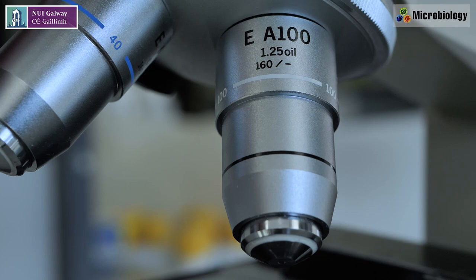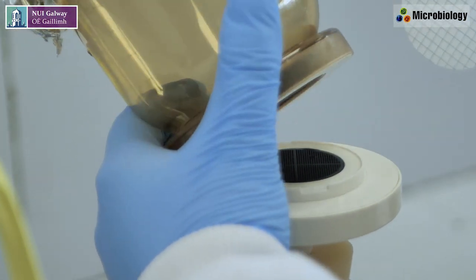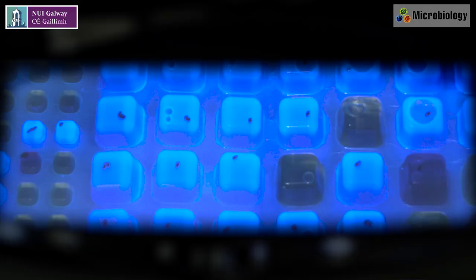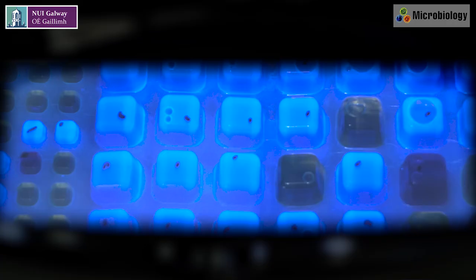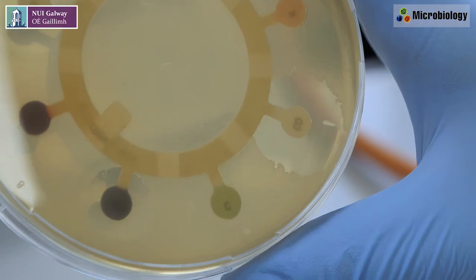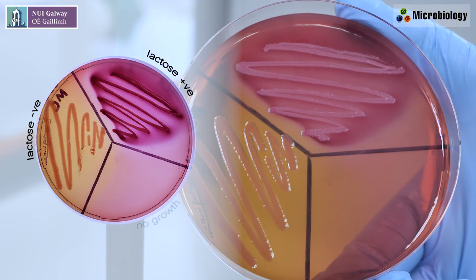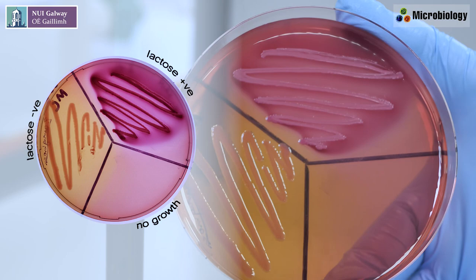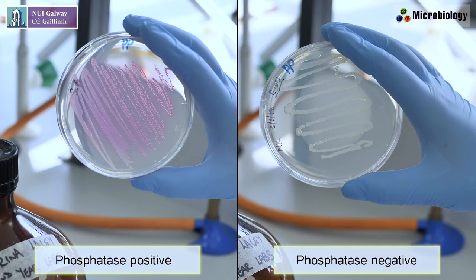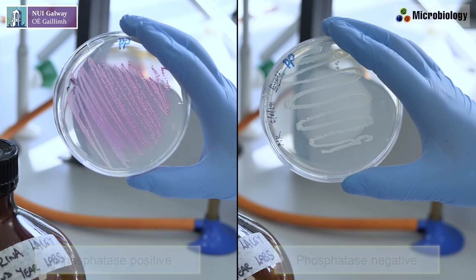They also cover detecting and counting the numbers of bacteria in water samples, measuring the sensitivity or resistance of different types of bacteria to antibiotics, and using biochemical tests to determine the properties of particular bacteria in order to understand how to grow them or kill them.